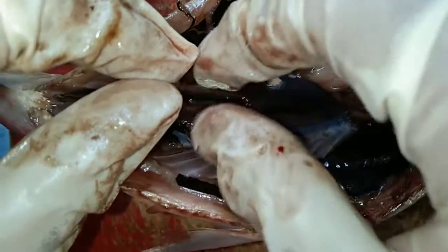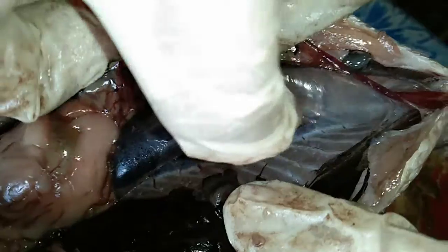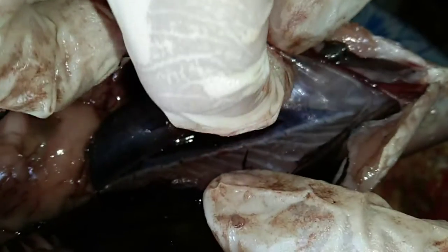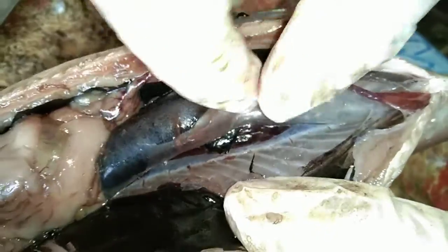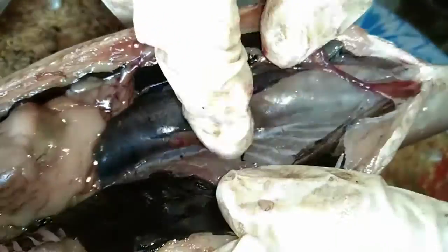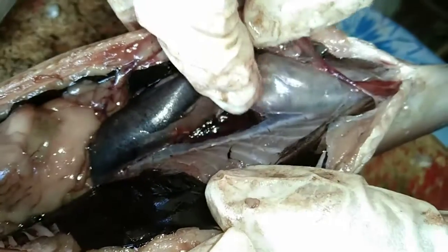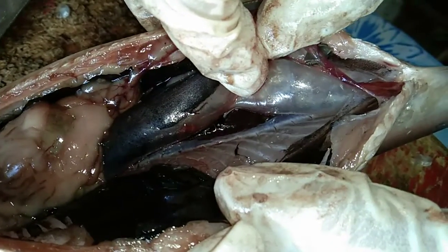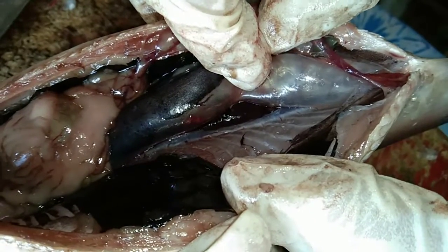This is the kidney. The kidneys filter liquid waste materials from the blood, and these wastes are then passed out of the body. The kidney also regulates water and salt concentrations within the fish body, allowing certain fish species to exist in fresh water or salt water.